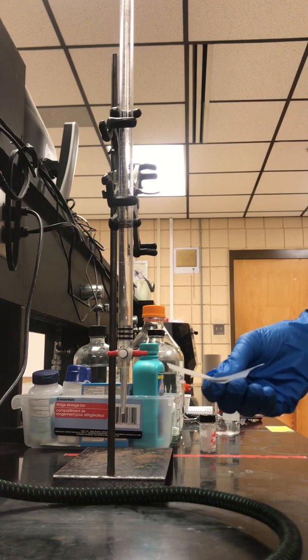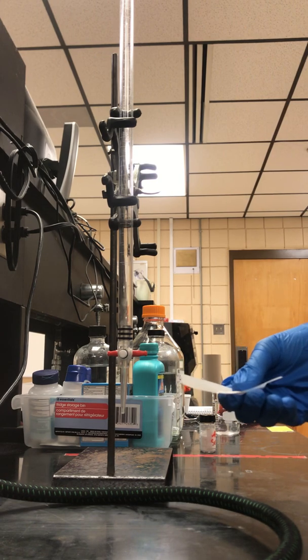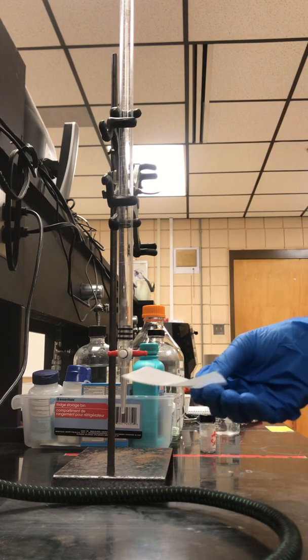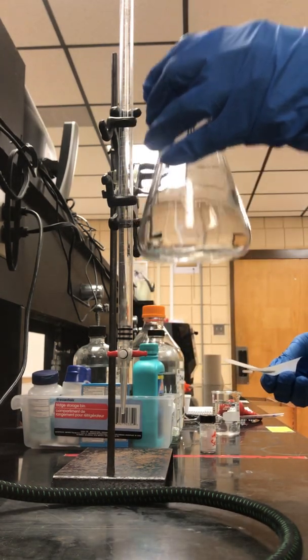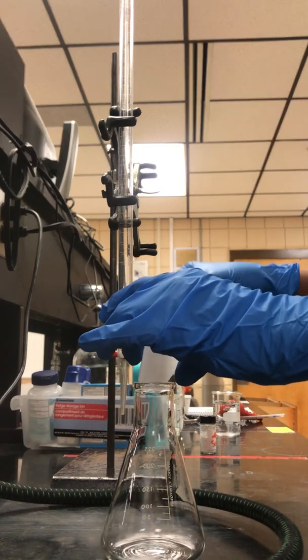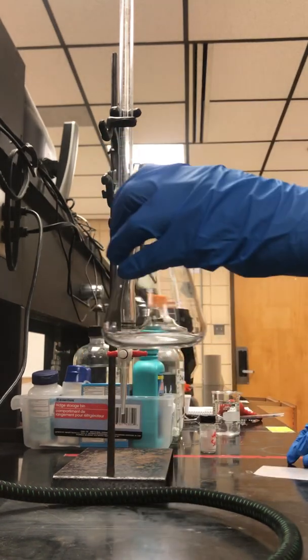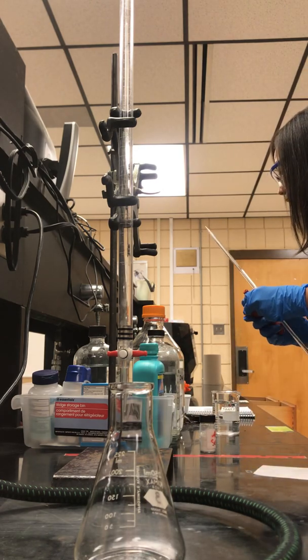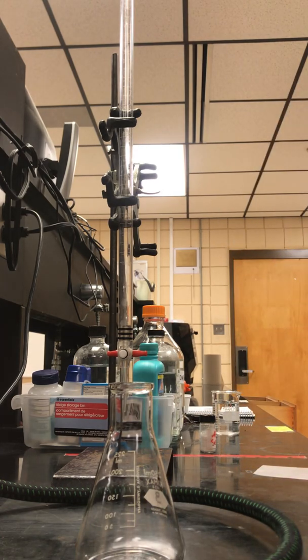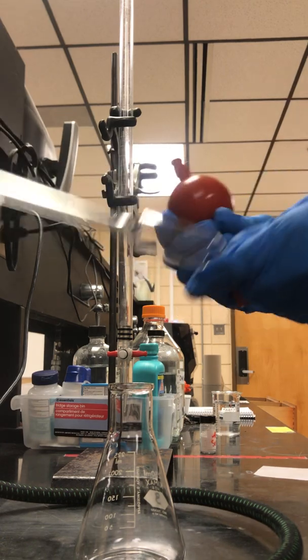You should go and weigh your unknown antacid that has already been pulverized. You want to take that and put it inside your Erlenmeyer flask.